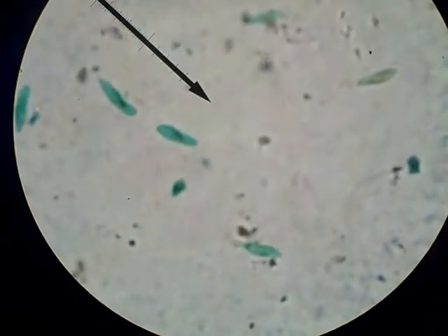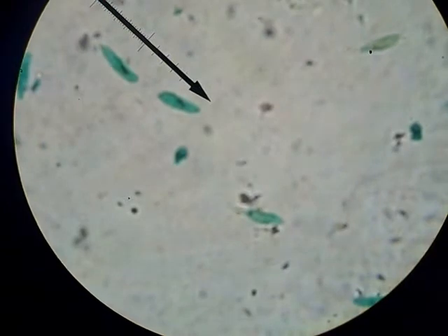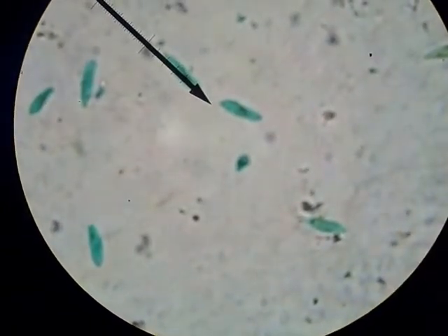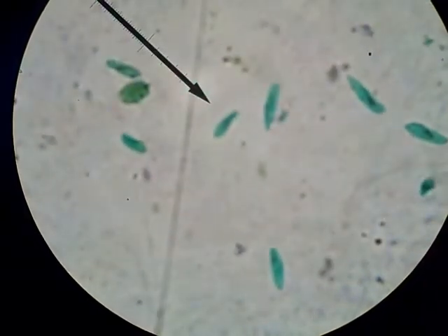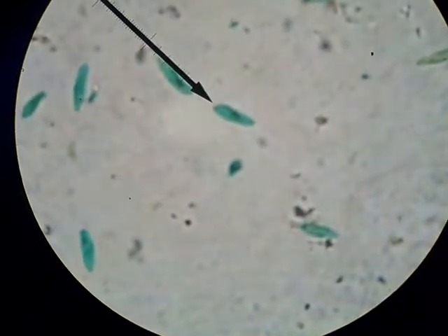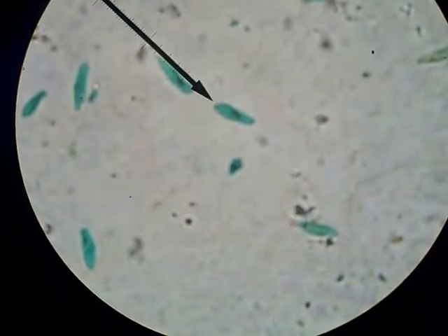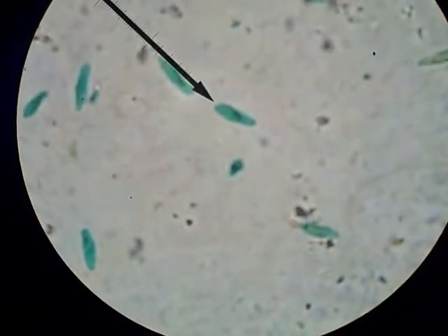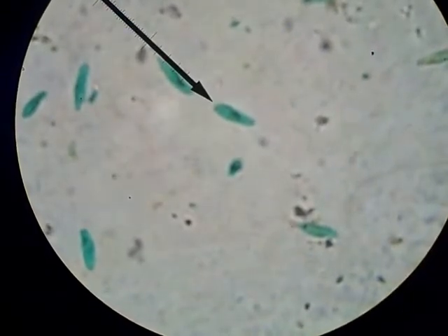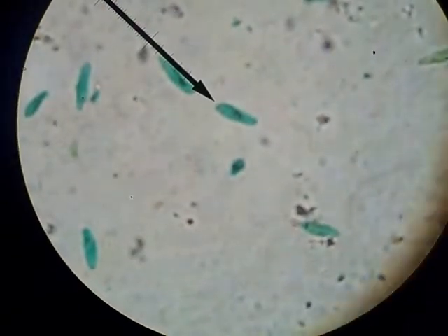Find an organism that looks interesting to you that you want to see closer up. Put it in the middle. Notice the organisms over at the side — especially this green one. The one that we want to see closer goes right in the middle now. When we go up one more power, I want you to see that the ones to the left disappear, because as you go up in your power, you have a smaller viewing area. So it's very important that you center the object that you want to see before going up on your magnification.